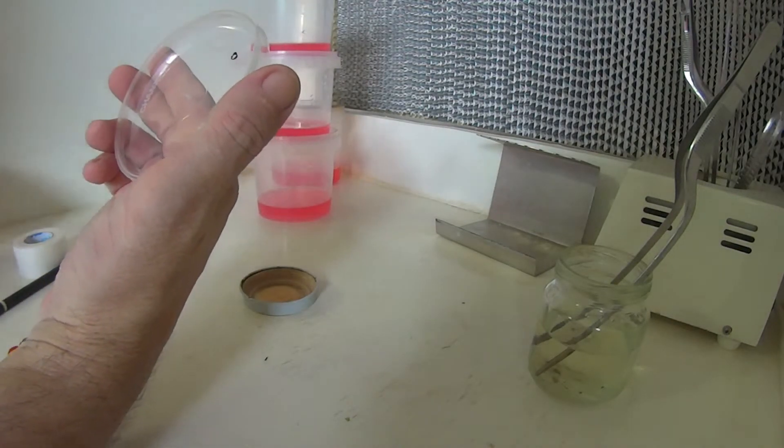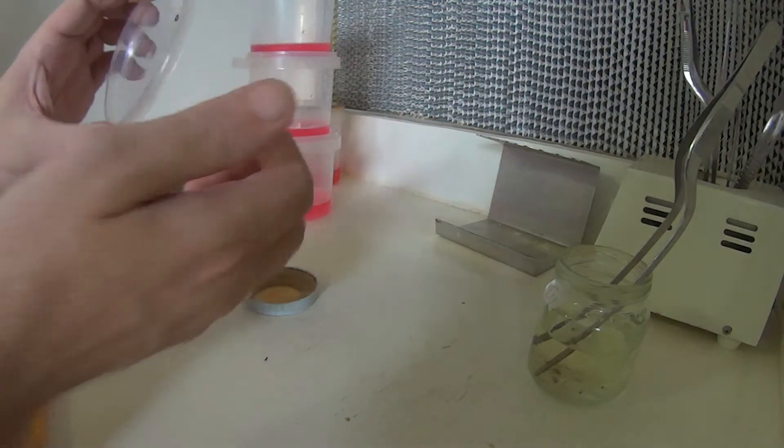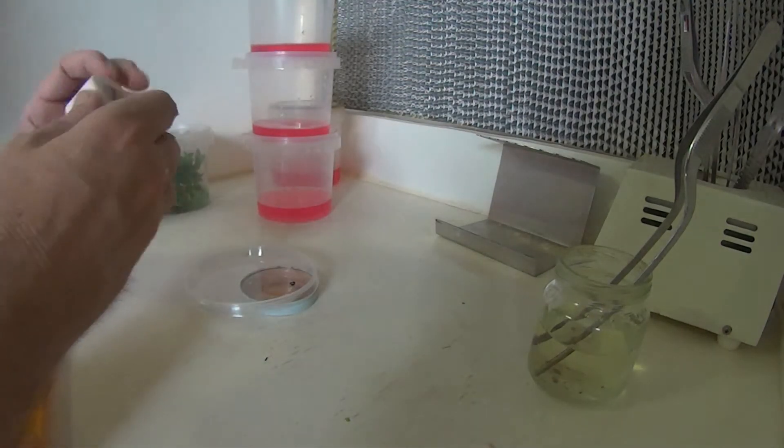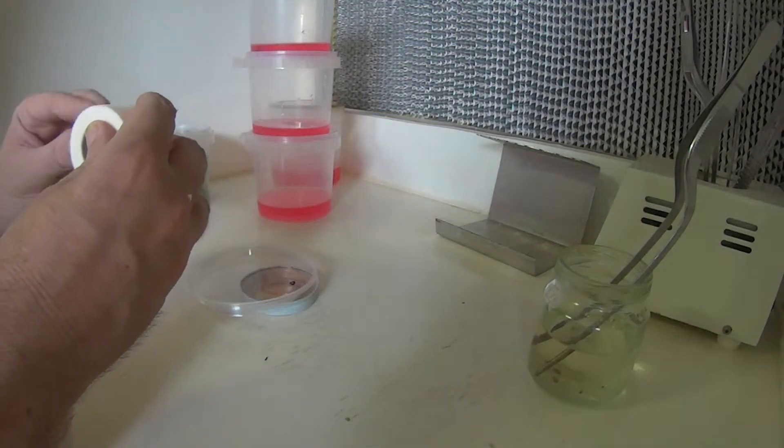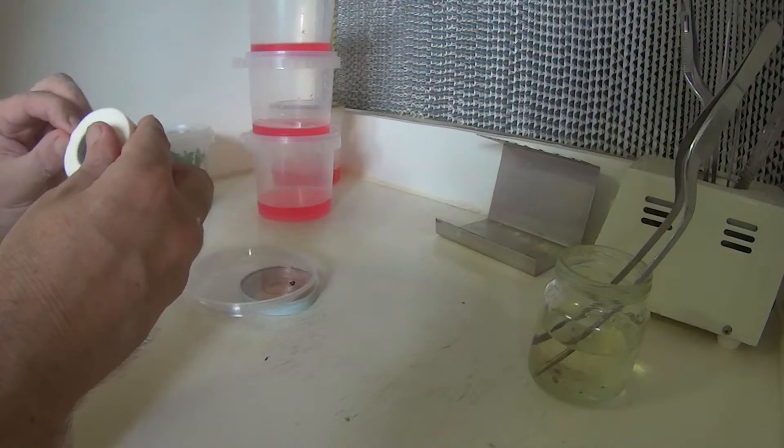It does make a little bit of a mess, but it's easily cleaned up. There's about a three to four millimeter hole, and then take a couple of small pieces of the micropore tape, if I can find the end of it.